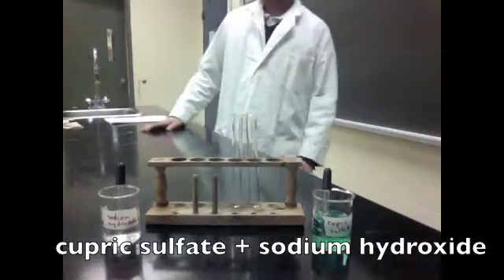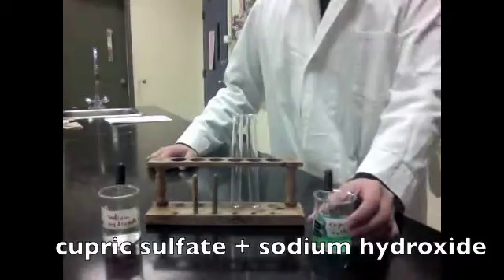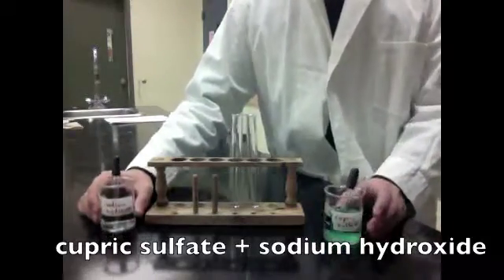Hey class, my name is James, and today we're going to be mixing two aqueous solutions, one of cupric sulfate and one sodium hydroxide.